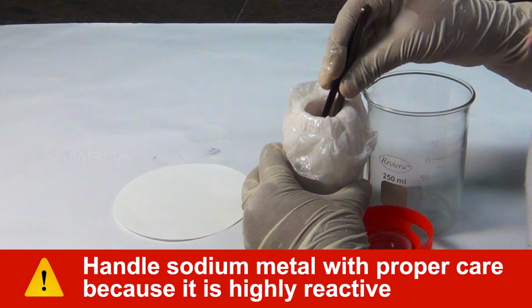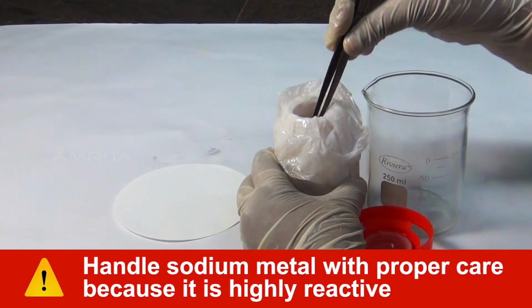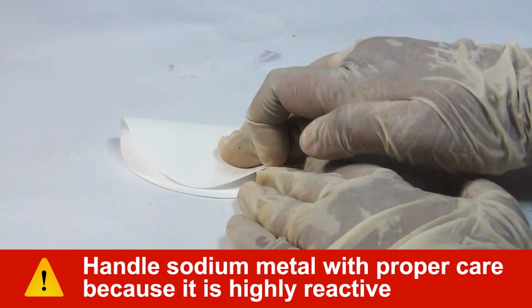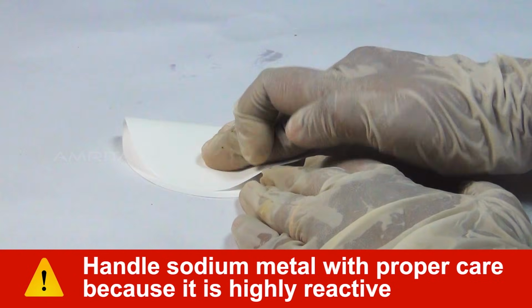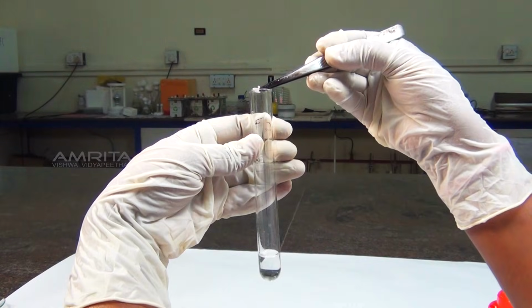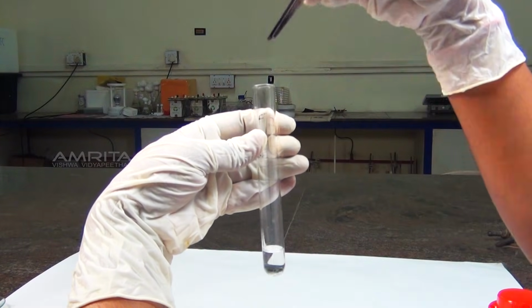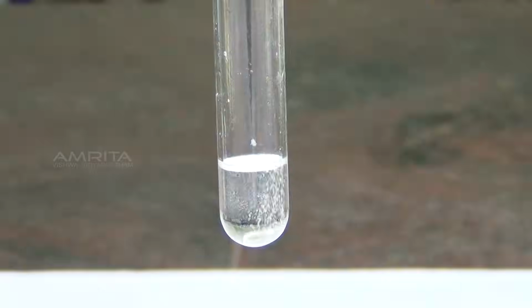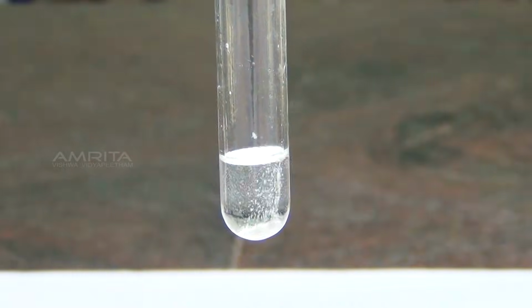Now, take a small piece of sodium metal using the forceps and place it on a filter paper. Dry sodium metal by pressing it between the folds of the filter paper. Now, put the dry piece of sodium into the organic compound using the forceps. Alcohol reacts with active metals like sodium to produce effervescence due to the liberation of hydrogen gas.